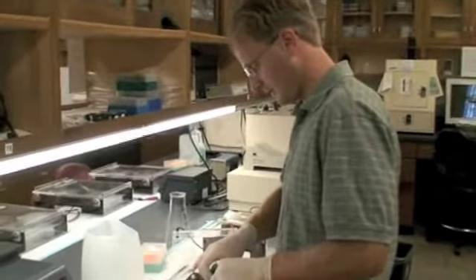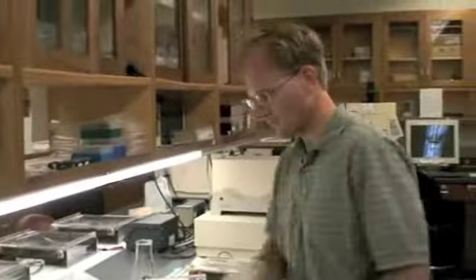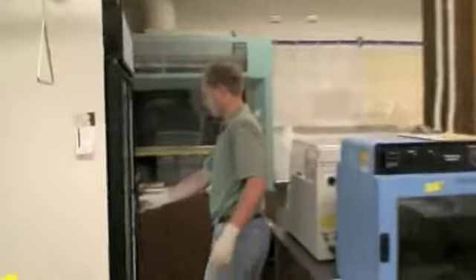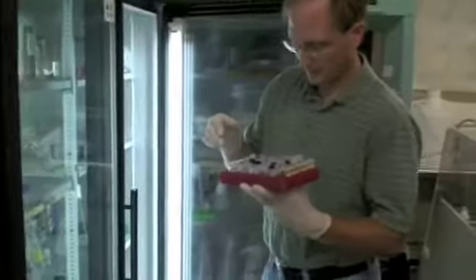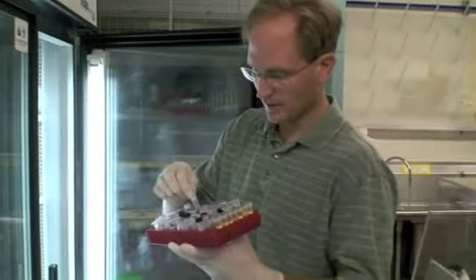But before we start loading our sample, I want to get up and make sure we have our ladder handy. Again, in this red tray, there is some ladder. There are different ladders.